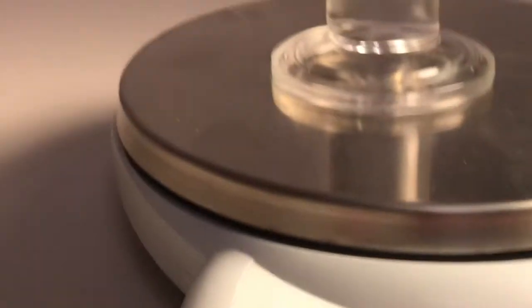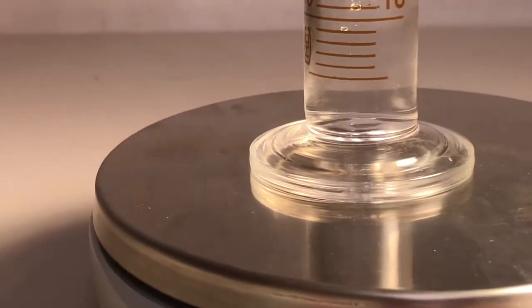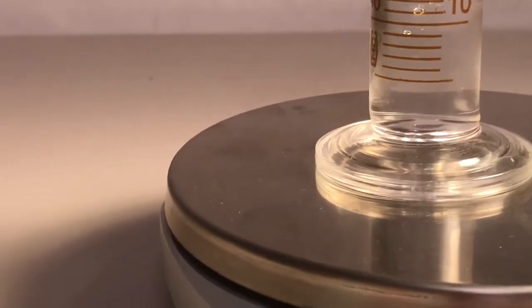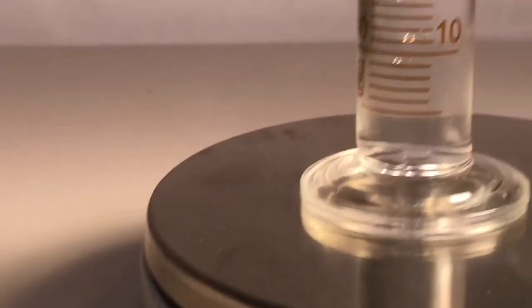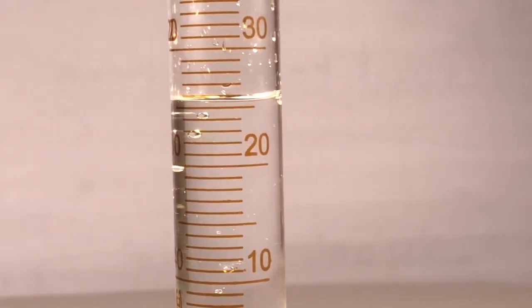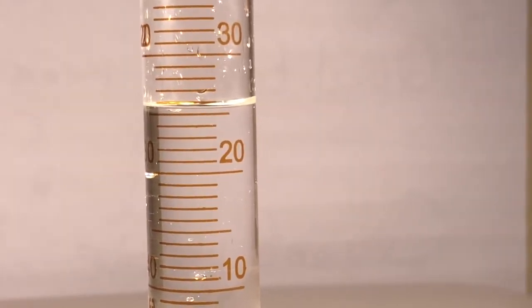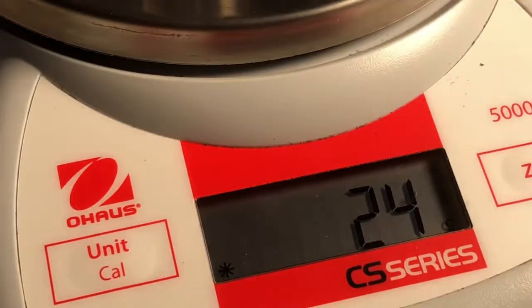Here we go. Here comes another liquid 1. Splooch into there. And another half of a kersploosh. What you got now? Eyeball says, what's that? I don't know. You call it. You call it. And mass.